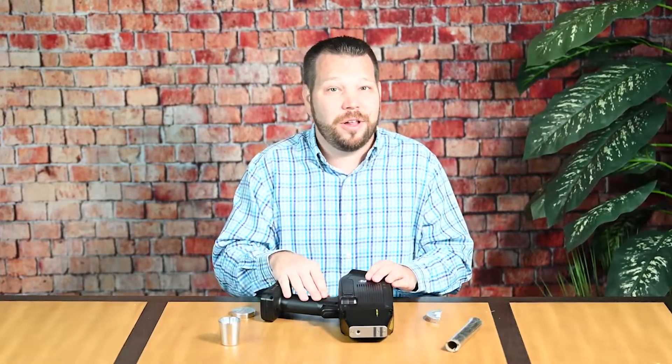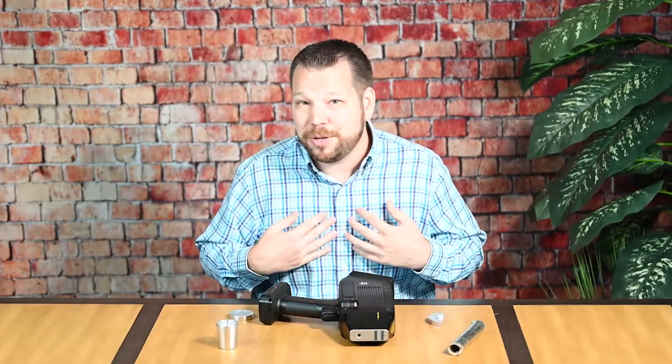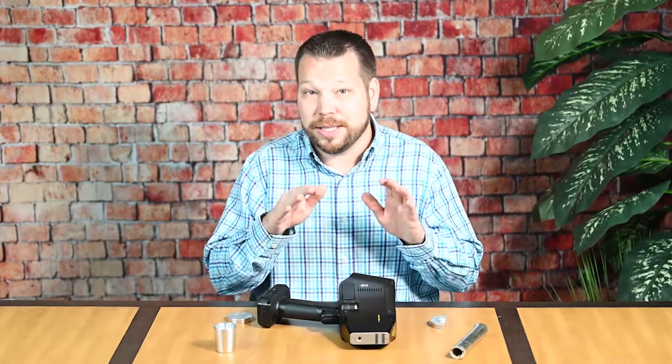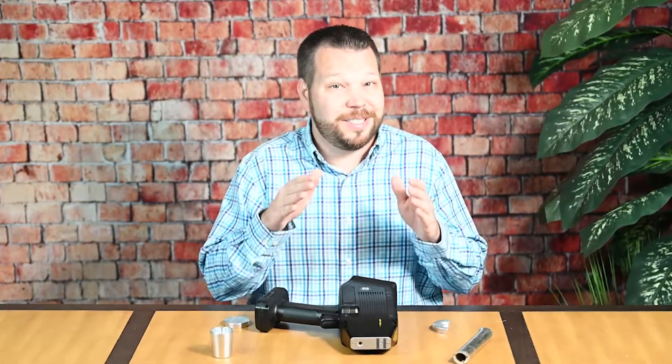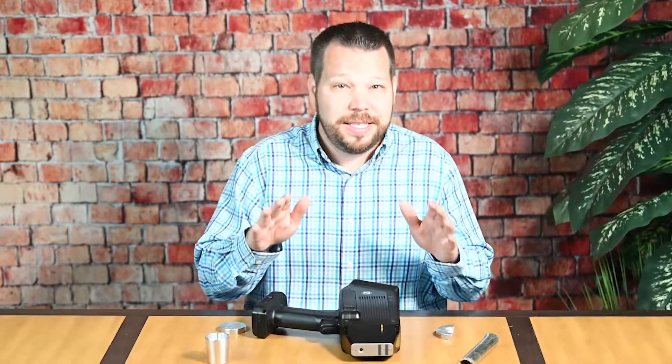Both handheld LIBS and handheld XRF technologies can do this sort, but my personal preference is handheld LIBS due to its light element superiority over XRF, its speed of analysis, and having no X-ray emission.